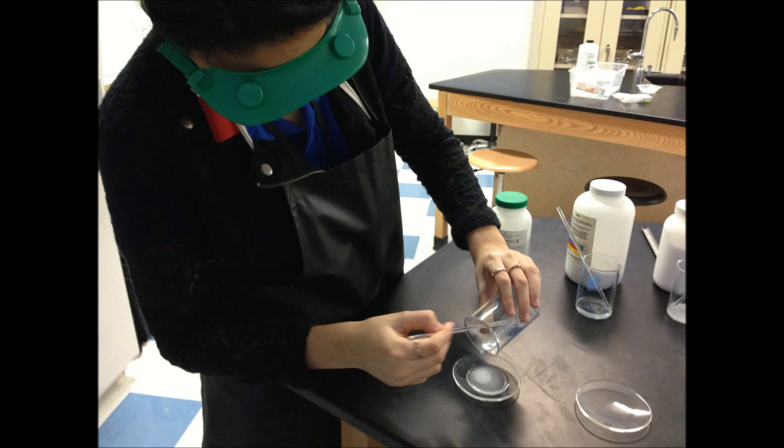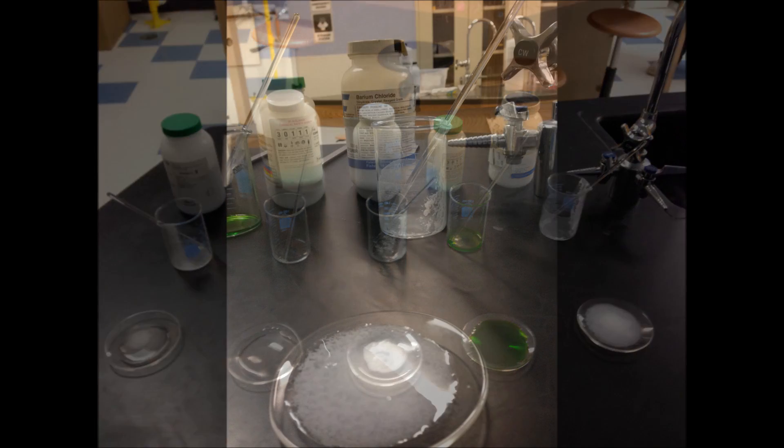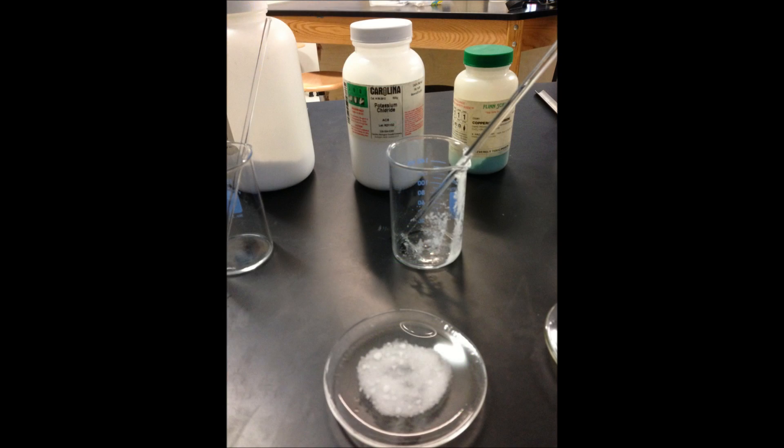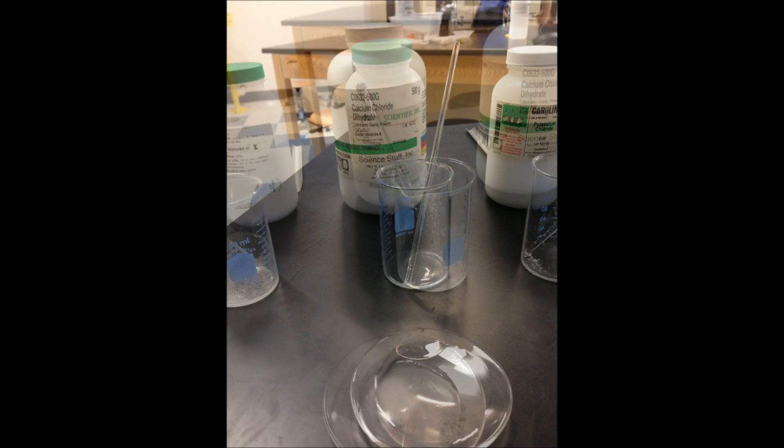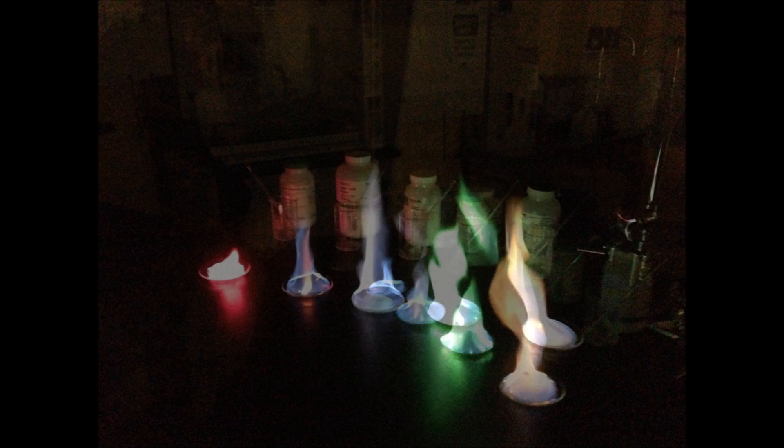Then, I poured nearly all the mixture onto each dish. Using a lighter, I then lit each of the mixtures that are now on the dishes.